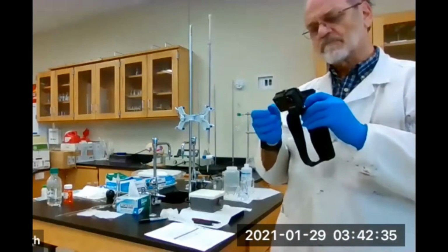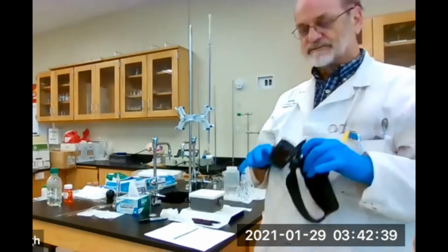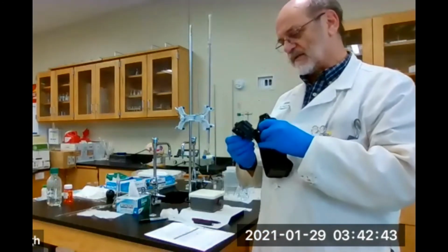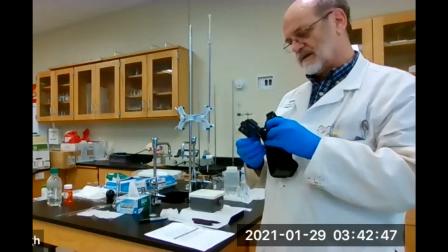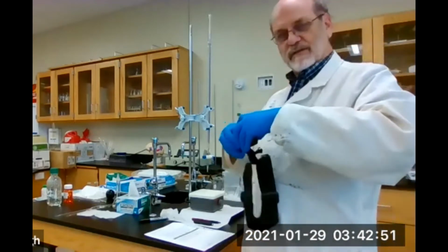In fact, I'm going to turn it off and replace the battery. Then my conscience is clear. So let's take the power down. There we go. And you can watch me change the battery if I leave this in the video.